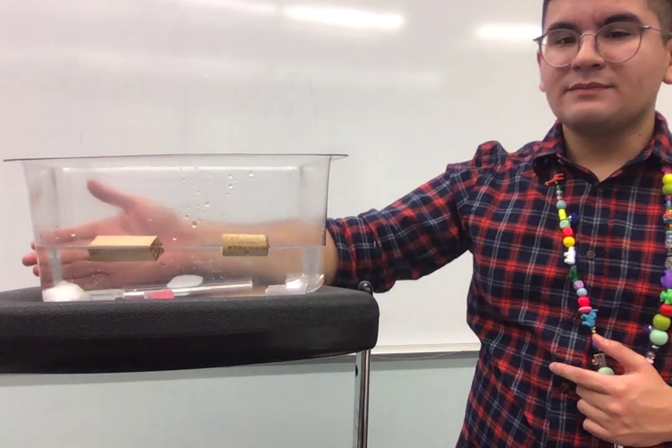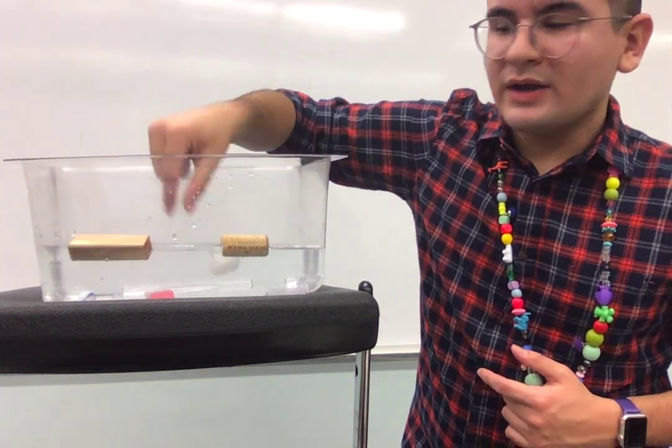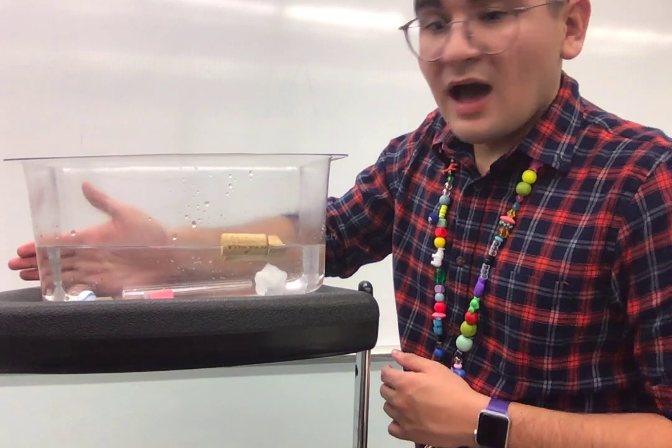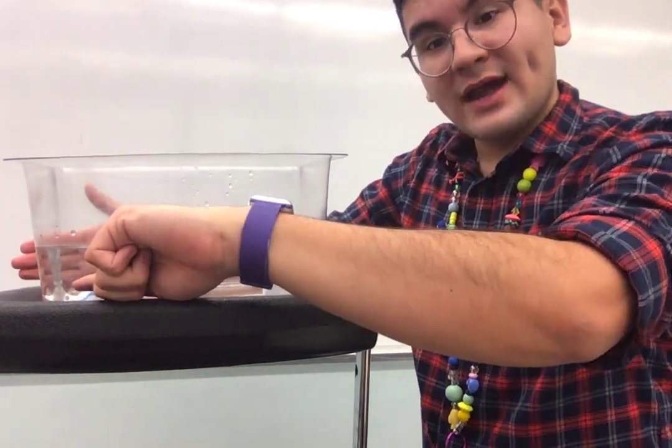Oop, you can't see it because of the glare. Actually, no, you can't see it because of the cotton ball. So let me move it out of the way. So, is our marble soluble? Let's see. I can still see it. Can you see it? You're right, it's right there.